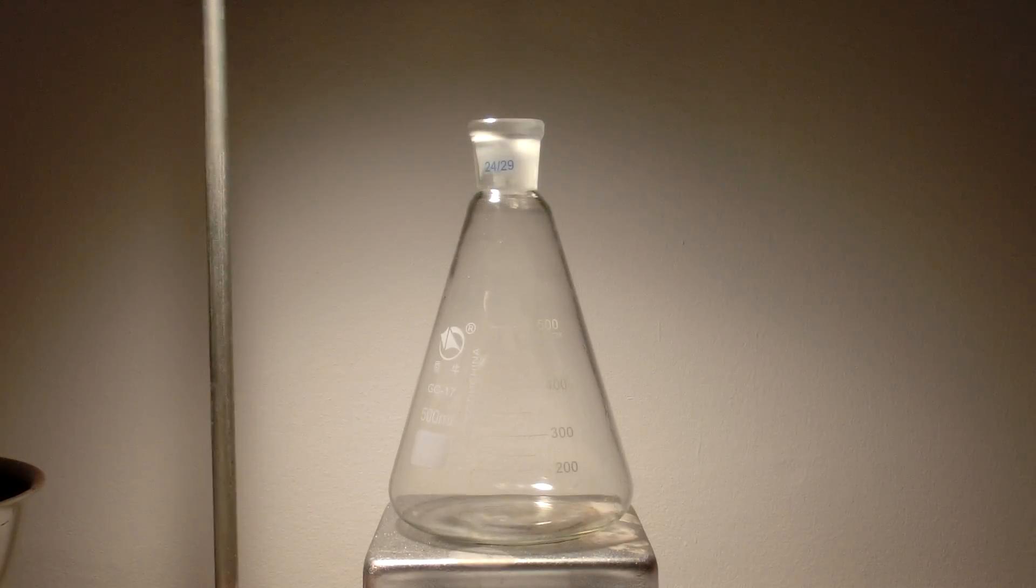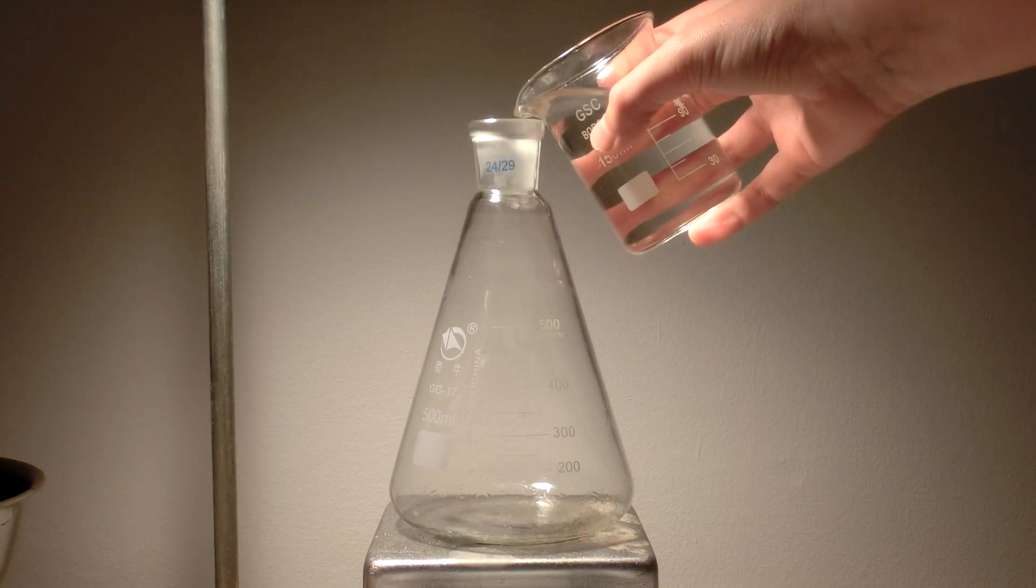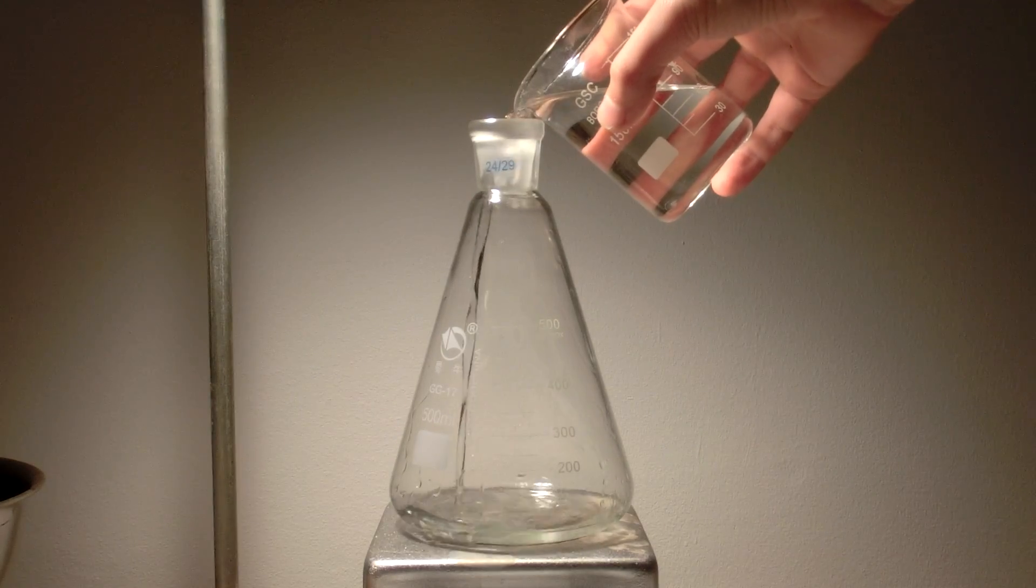Welcome to the Chemikid. In this video, we will isolate acetylsalicylic acid from aspirin tablets.